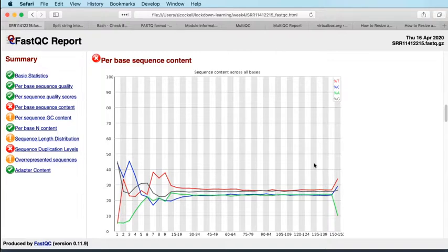what you will find, as we go through these reports, when we look at the MultiQC, for instance, is that this pattern is the same across our whole experiment. It's not different between our different samples, and it's not even, as you might expect, different between the 4 SRA accessions taken from a single sample, but it will also not be different between all of our 48 files. This pattern of bias will repeat again and again and again.